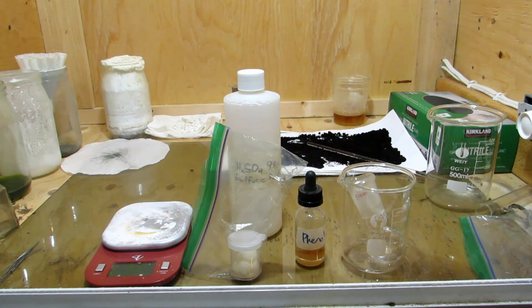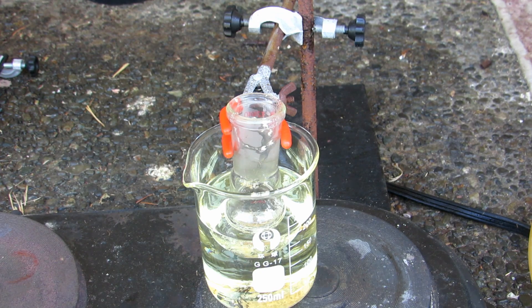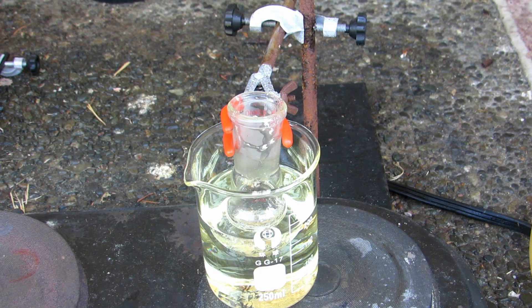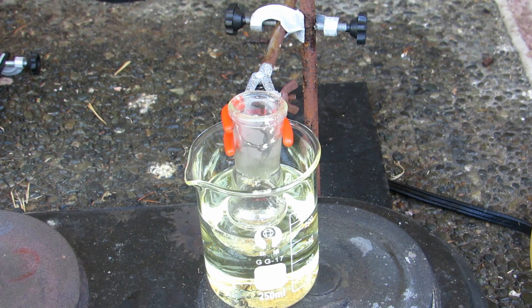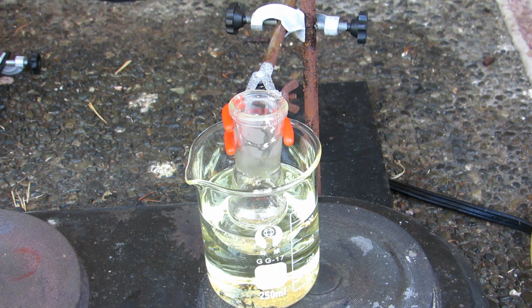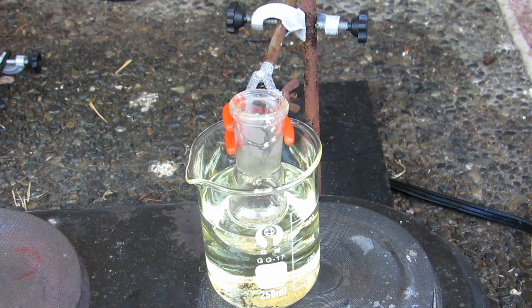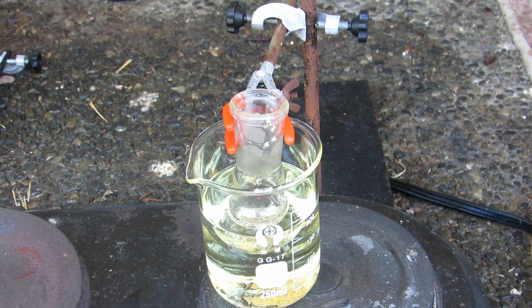Hopefully we'll start to see the characteristic red color of phenolphthalein forming as the reaction takes place. Now it's being heated — we'll stick a thermometer into the oil bath to keep it below 180 degrees Celsius, which is the temperature at which phenol will start to boil. We want to keep the temperature above 100°C but below 180°C so the reaction can proceed, the water produced can be boiled away, but we don't boil off our phenol.